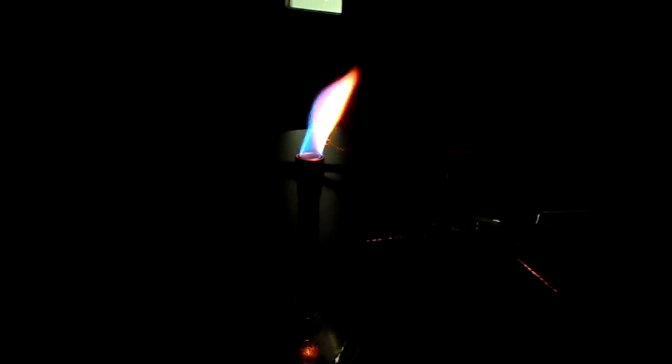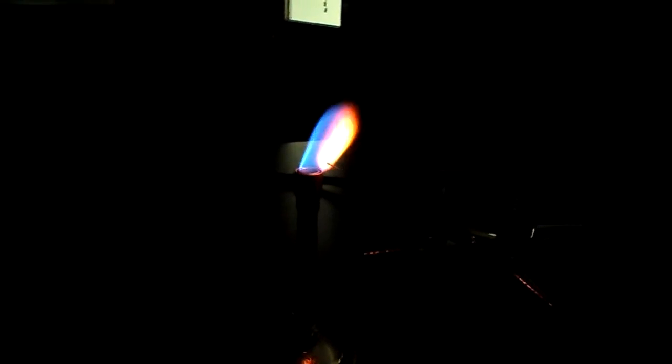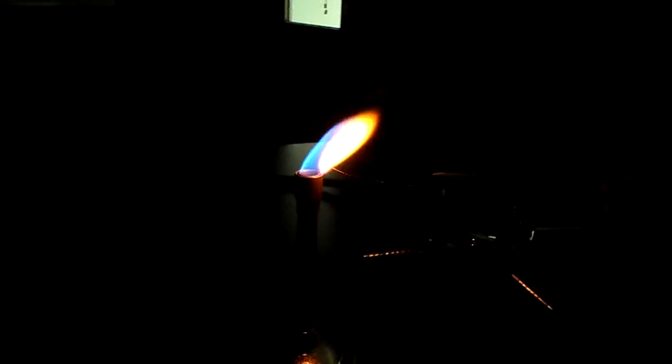I think I'm burning my metal now. All right, next we have lithium Li+. So it's in my solution. Okay, so I see orange and red in there. And let's just make sure.